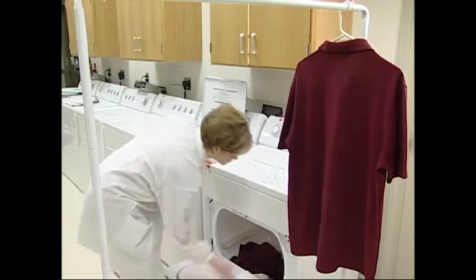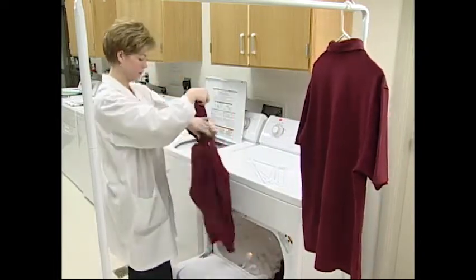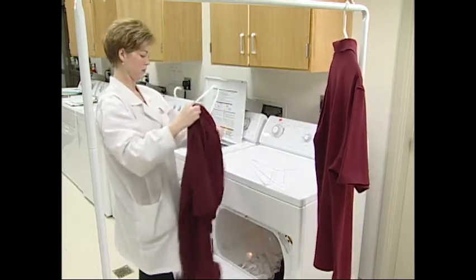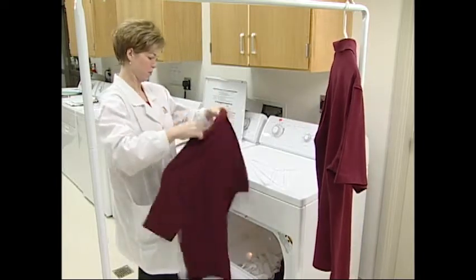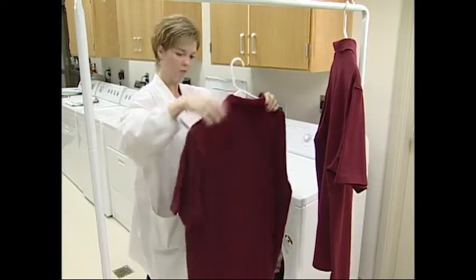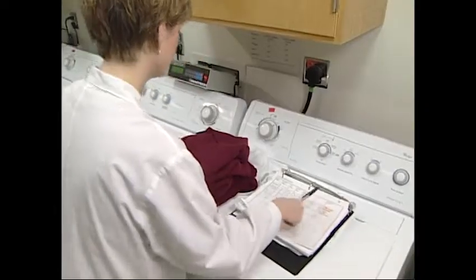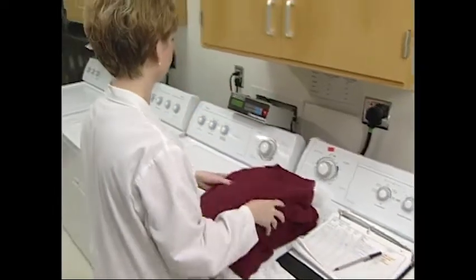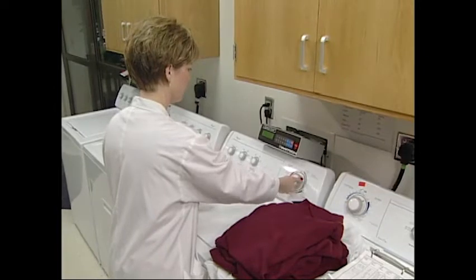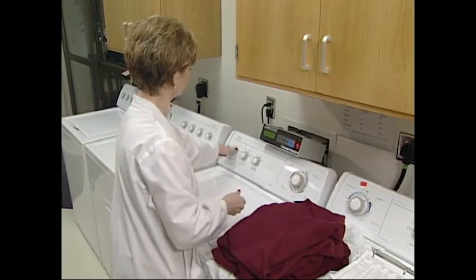For complete and reliable shrinkage results, it's recommended to wash and tumble dry at least three cycles, but preferably five cycles. Almost all evaluations of dimensional stability executed by the industry make use of some version of these tests.